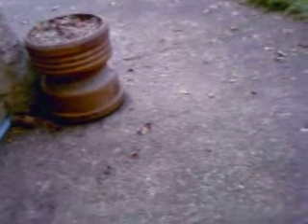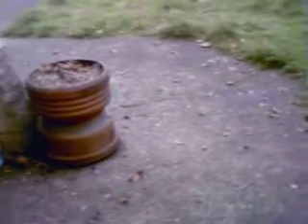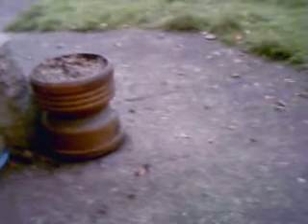It does not look like you're being able to look inside the furnace and see what's going on. So what I'm doing is just waiting for the lead to completely go molten into a perfectly round circular pool, then waiting for the scum on the surface to dissolve. Also watching to see if they start to spit. Whenever the cupels are manufactured, if there's any calcium carbonate in the material the cupels are made of, they will gas off CO2 and will cause lead to spit and that means precious metal loss. So I've got to hang out and make sure that doesn't happen. If it starts to look like it's going to try to spit, I've got to turn the heat down, wait for the gas off, then turn the furnace back up.